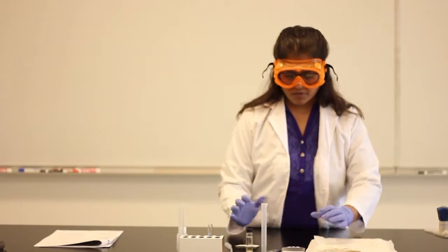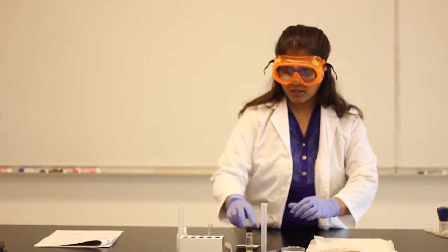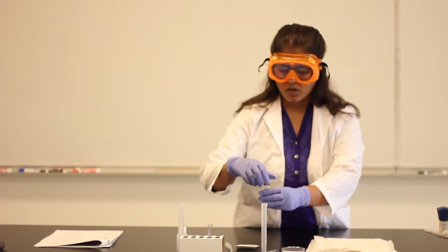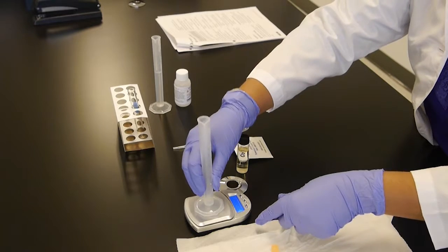And then we're going to do quality testing on the biodiesel produced. Here, after 48 hours of mixing all the reactants, we're here to test some of the properties of this biodiesel. So first of all, let's see the density. We're going to need a graduated cylinder.